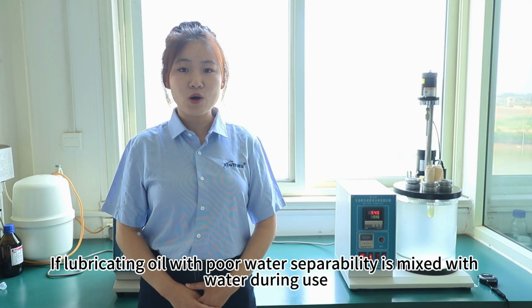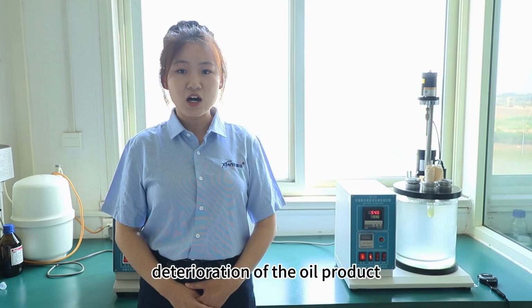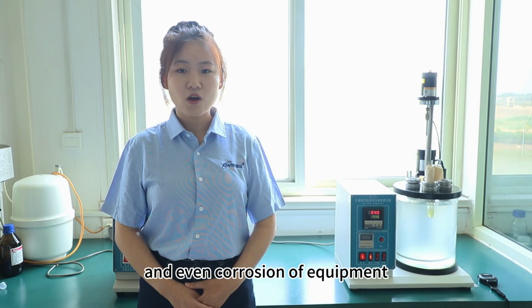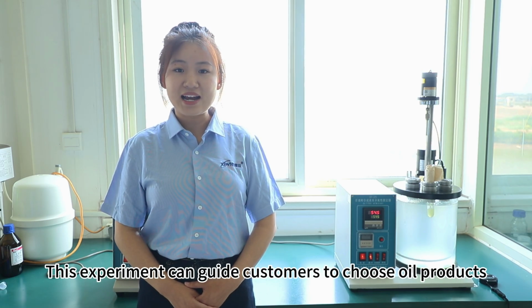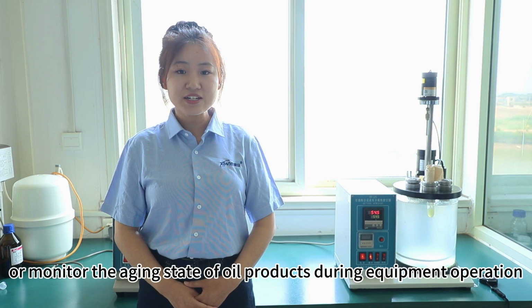If lubricating oil with poor water separability is mixed with water during use, it may lead to emulsification, deterioration of the oil product, decline in lubrication effect, or even corrosion of equipment. This experiment can guide customers to choose oil products with excellent anti-emulsification performance or monitor the aging state of oil products during equipment operation. That's all for today.